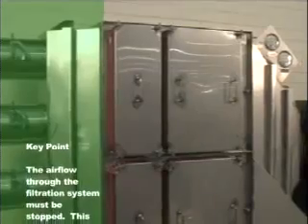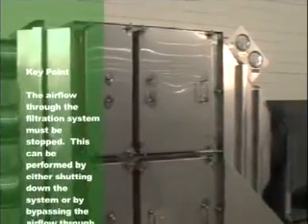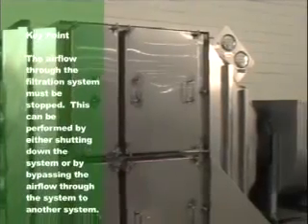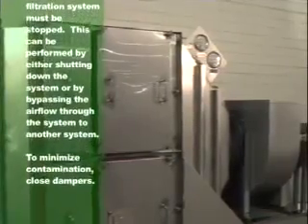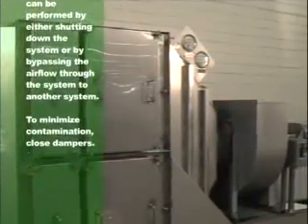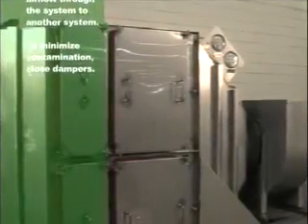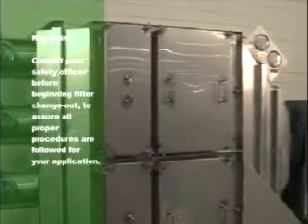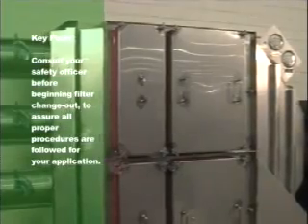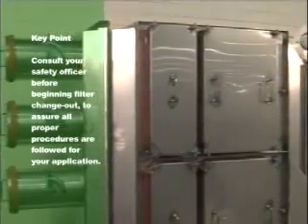Prior to replacing a contaminated filter, the airflow through the filtration system must be stopped. This can be performed by either shutting down the system or bypassing the airflow through the system to another system. To minimize contamination, close upstream and downstream dampers. It is also a good idea to have a table nearby or change-out shelf, available through BSL4, to place the new and old filters during changeout. Prior to beginning changeout procedures, consult your safety officer to ensure all proper procedures are followed for your specific application.